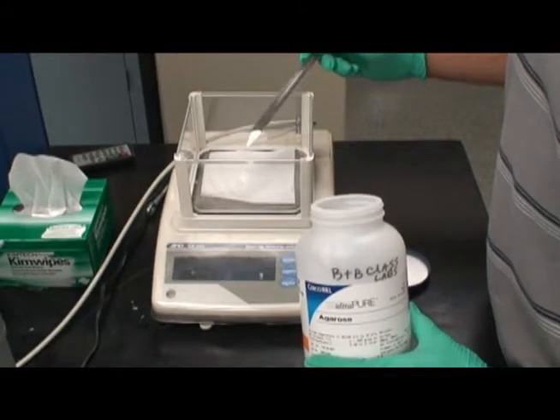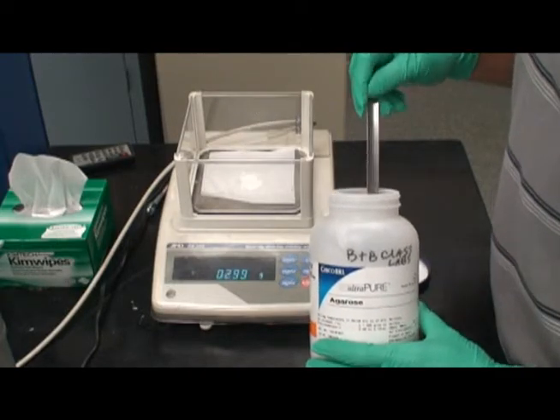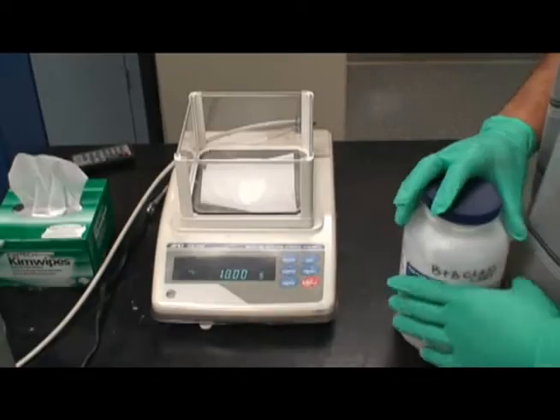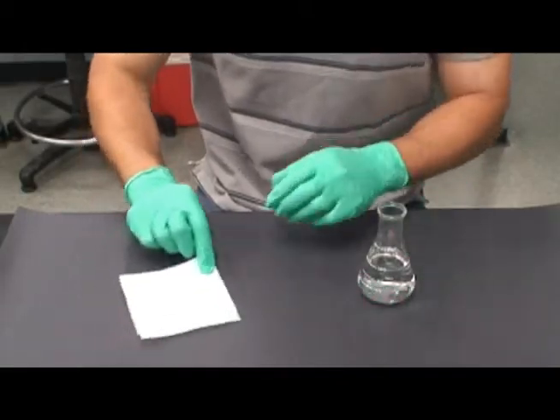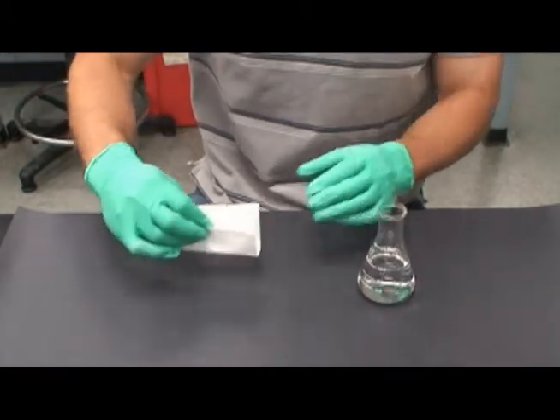Measuring out exactly 1 gram of agarose may take a little time. Don't get discouraged. Once 1 gram of agarose has been measured, carefully remove from the scale and add the agarose to the 100 milliliters of buffer TBE, which has already been measured out in a flask.